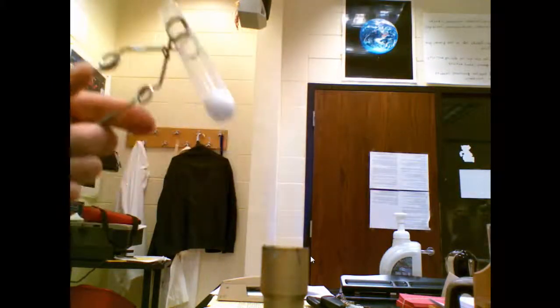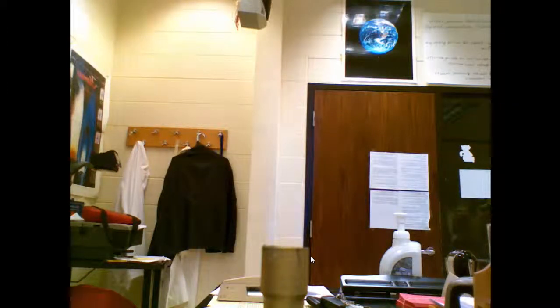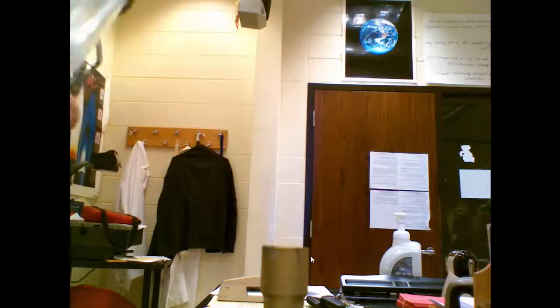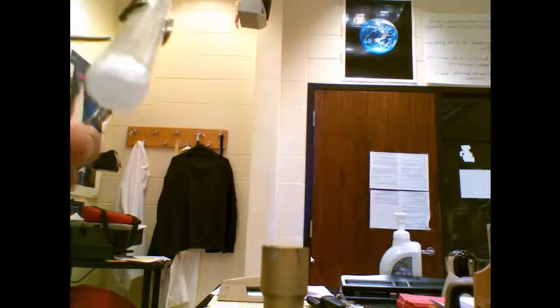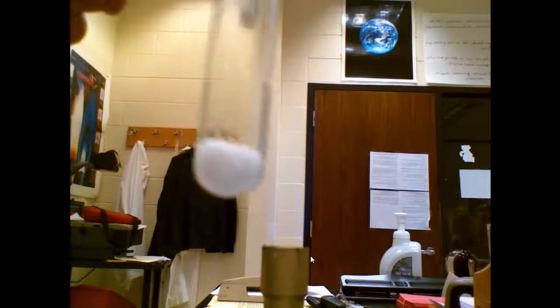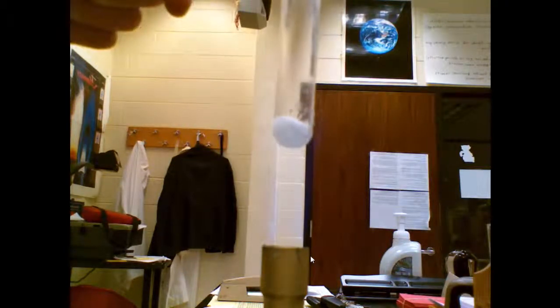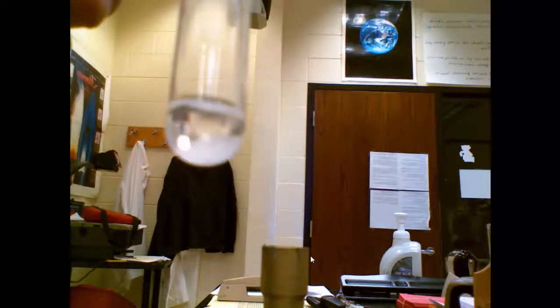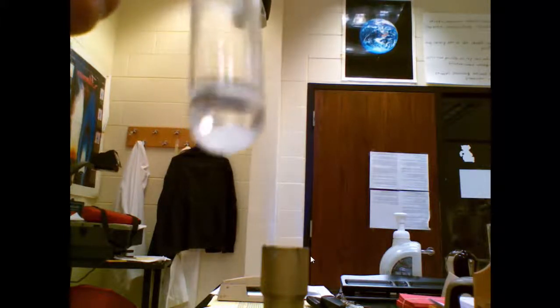This is crystal number nine. Crystal number nine is a granular powder, a little bit larger particle size. I put the sample in the Bunsen burner and it immediately started to melt. If I put it in a little longer, you can see it's turning into a liquid. Continuing to melt. So crystal number nine melted immediately before the flame turned yellow. In fact, basically upon putting it inside the flame, crystal nine melted.